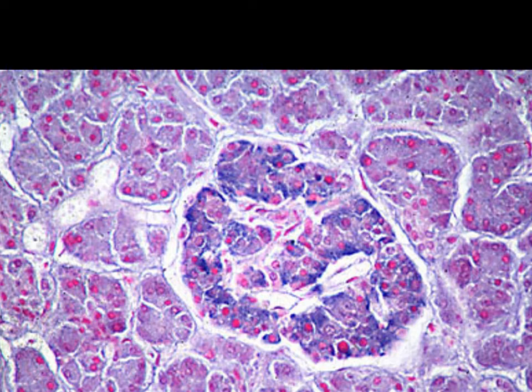So once again, we have an islet, pretty well defined in there in terms of the overall islet itself. And then we once again have kind of red staining cells. And then we have blue staining cells, or in this case, it's almost like more of a dark purple in terms of that. And so we once again have our betas, and then we have our alphas.